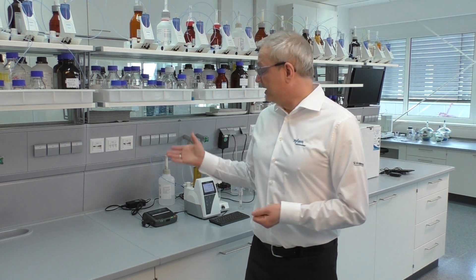We will show you the setup of the automatic titrator, how you connect an electrode, how you carry out a pH calibration, and how you fill in the reagent into the burette and prepare the sample and all other things which are necessary to carry out an automatic titration.